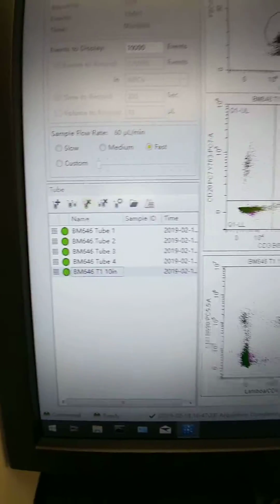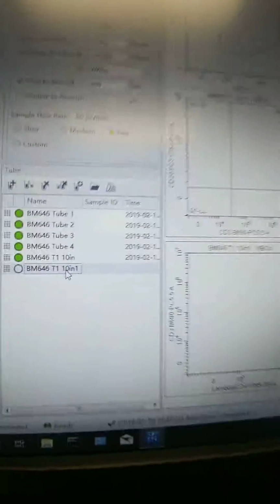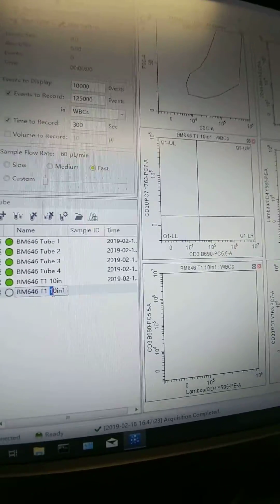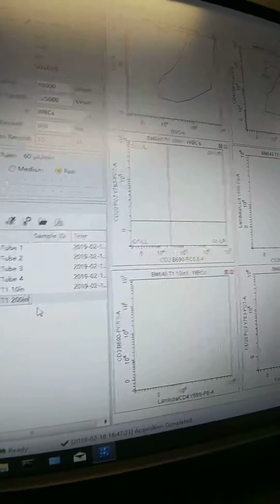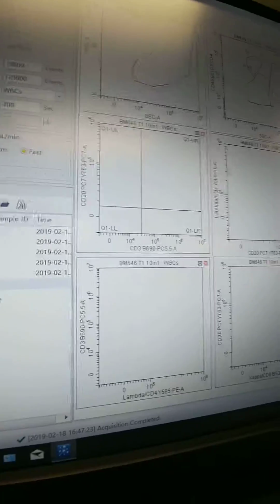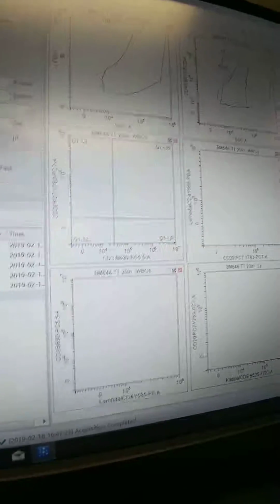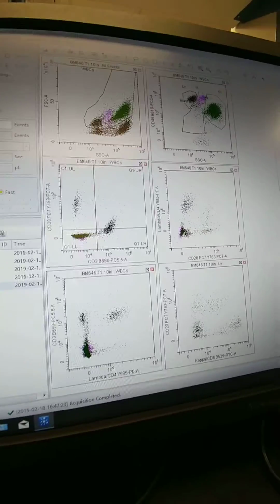So now I'm going to select this tube, hit the little tube with the plus again for another new tube. See, it duplicated that, but now I'm going to change this to 20. I'm not sure what that is. Oops, not 220, increase. Over here we did increase 20, so let's change that to 2.